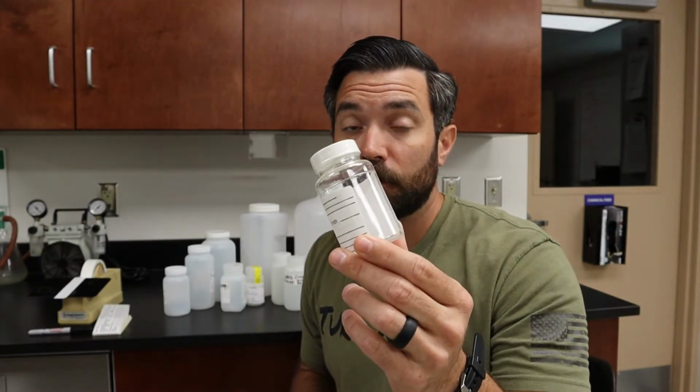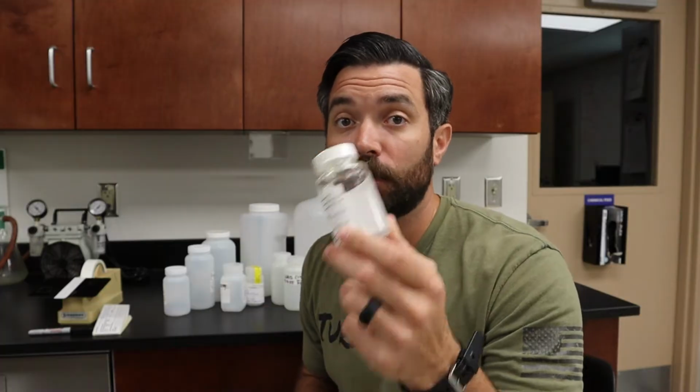Don't just dump that out. That's very important. That is actually sodium thiosulfate, and that is in there to remove any chlorine that may be present in your sample if you're sampling for fecal. Cross-contamination is a very big deal regarding your fecal samples. Make sure you follow your plant specific protocol regarding sampling for fecal so that there is no cross-contamination.